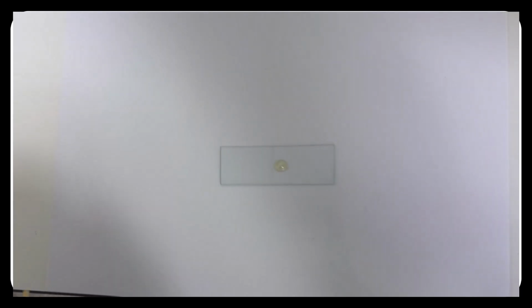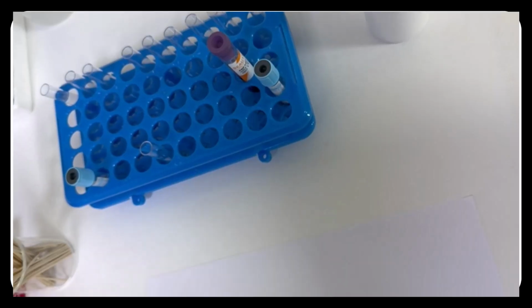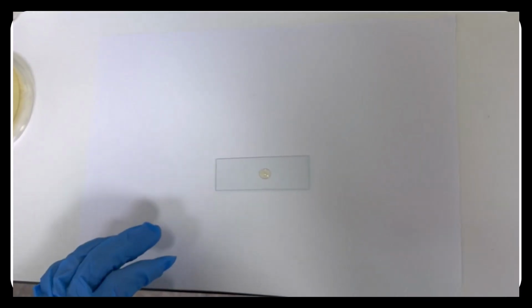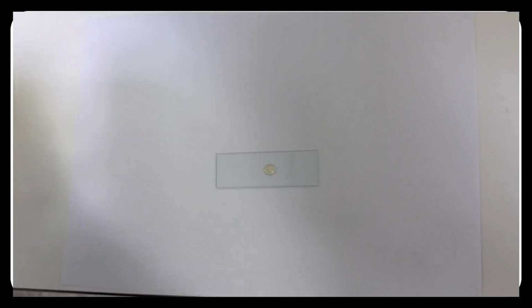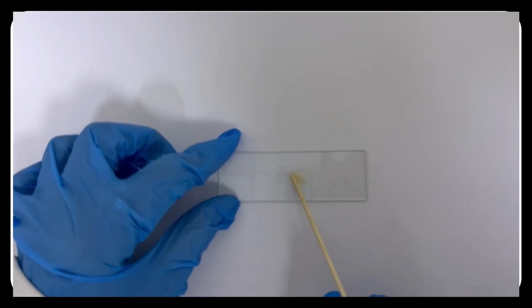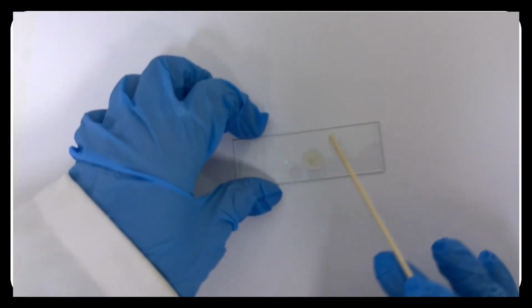The coagulase test includes two methods, the slide method and the tube method. The tube method is for detection of free coagulase, while the slide method is for the bound coagulase. Bound coagulase means it is bound to the cell wall of the bacteria, and we can detect it simply by the slide method. The procedure is very simple. Put a drop of the plasma on a clean slide. Then we take the bacteria colony and mix it with this drop of the plasma. Within just a few seconds, maybe one or two minutes, the clump will be formed, which indicates the positive result.